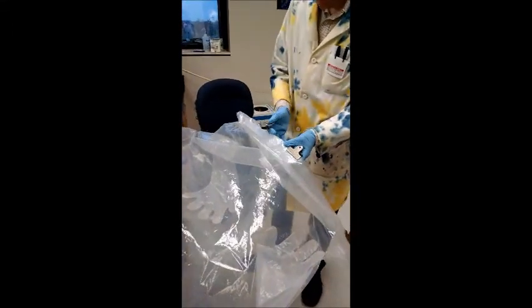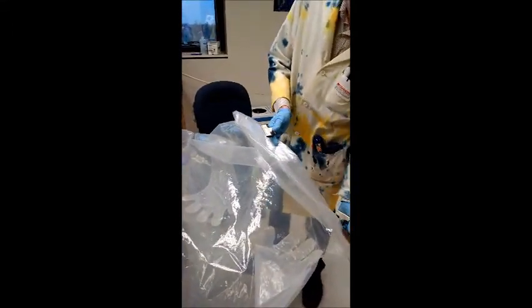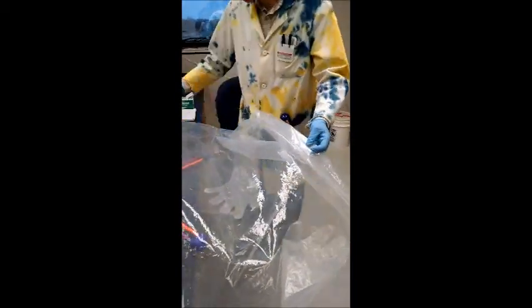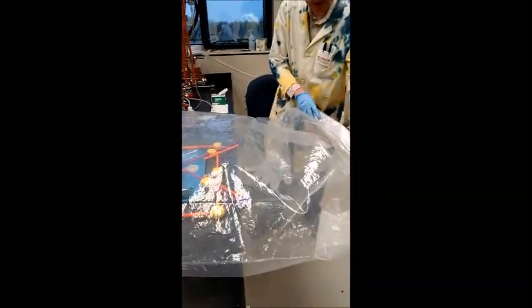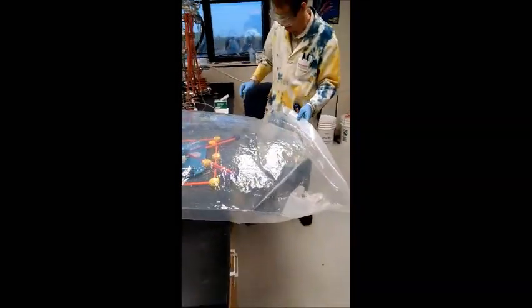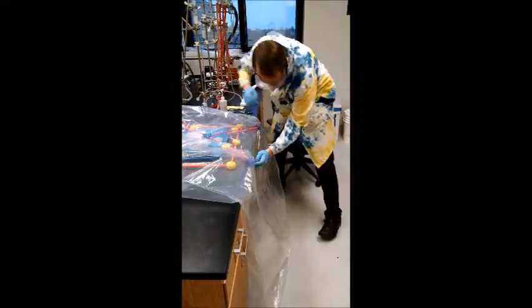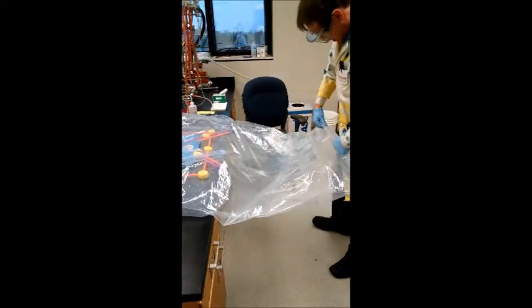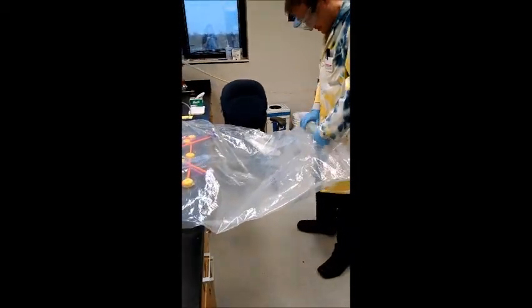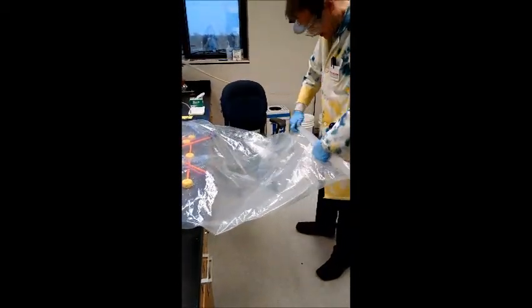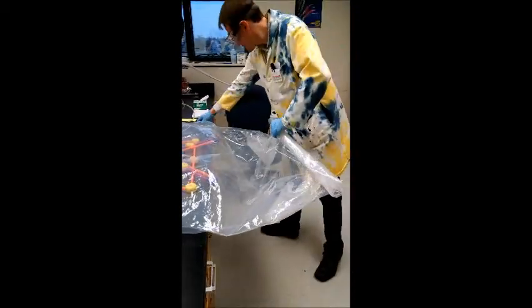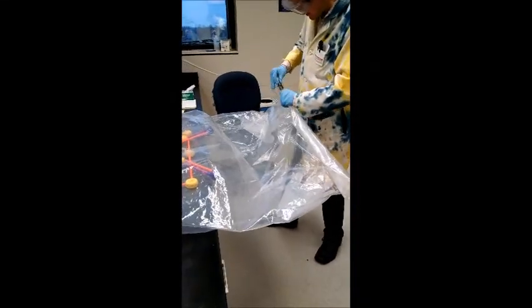We'll unclip the folded entrance here. Starting from the back we're going to push the argon out and then quickly close the entrance again. Fold it up three times so that air can't get back inside the bag. Hold together with this clip.